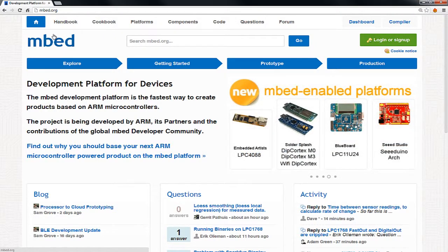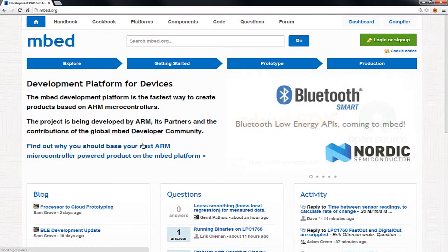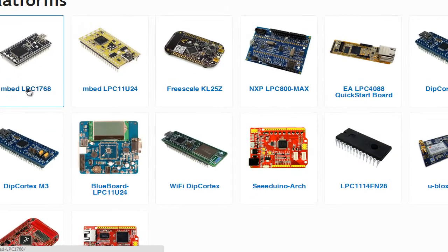The microcontroller that is used to drive everything on the Chem control box is one of these Mbed platforms. An Mbed is a microcontroller on a little board that has a nice bootloader and a nice online system for libraries and whatnot. We are using the Mbed LPC1768, which was actually the first Mbed platform made. Think of it as somewhat like the Arduino platform: just a microcontroller with a convenient, easy way to program it.